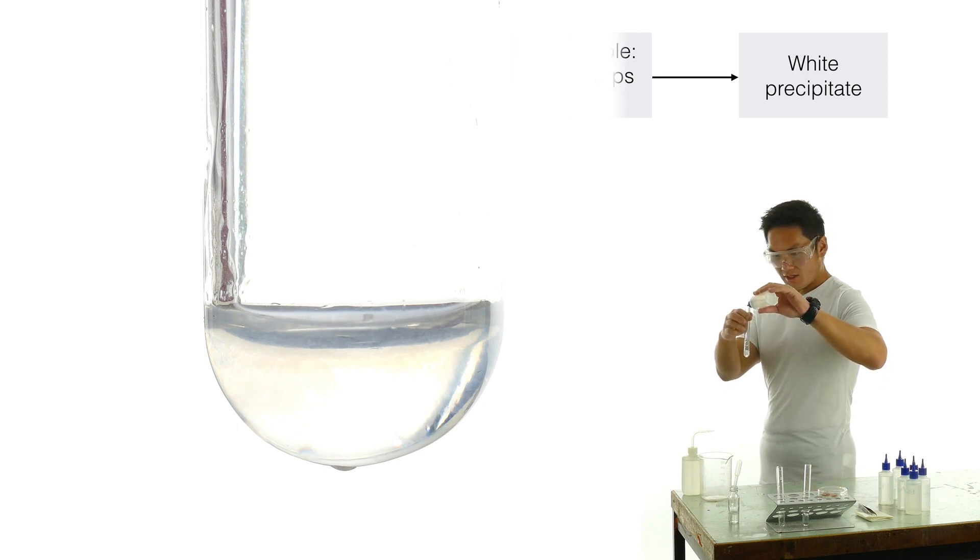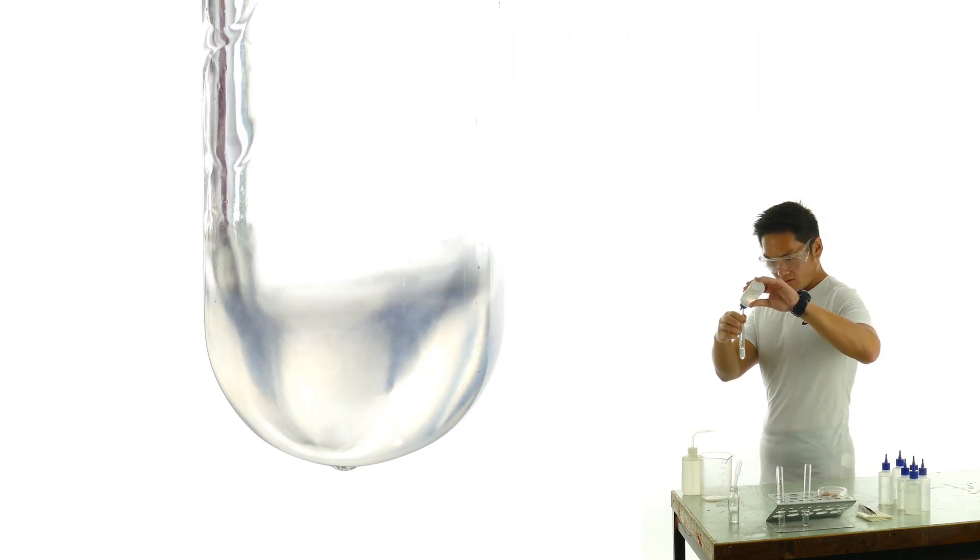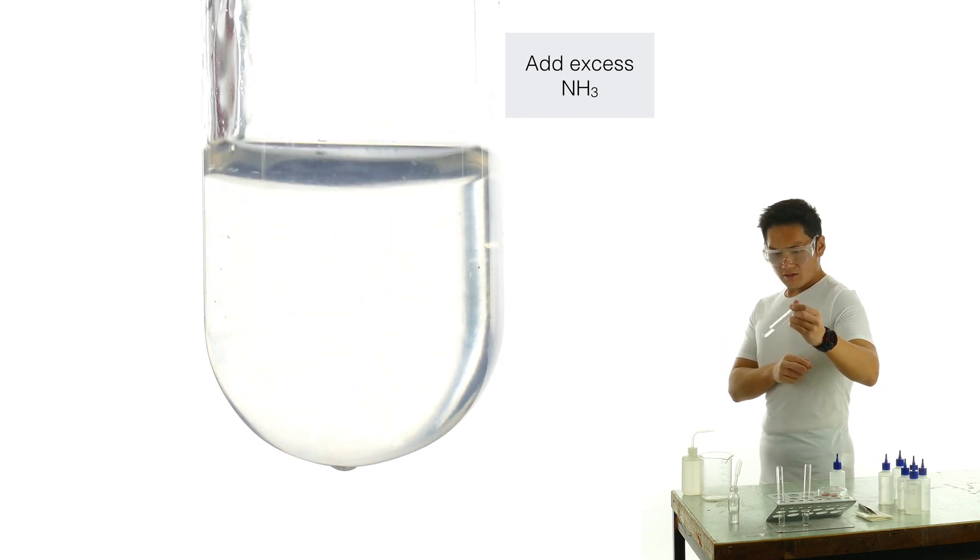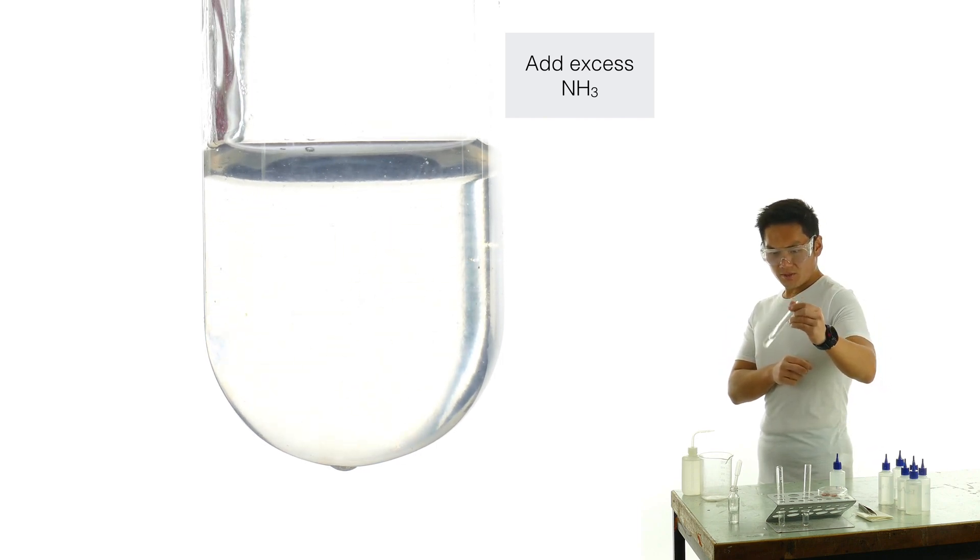Now I'm going to add excess ammonia. It's still there, it's not disappearing.